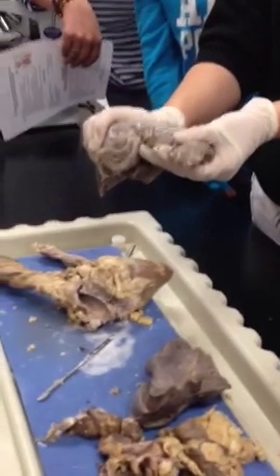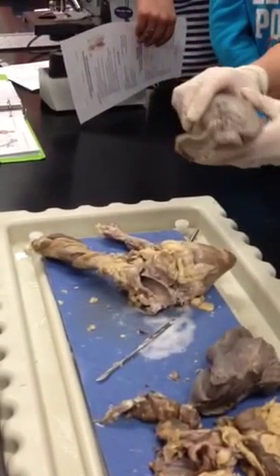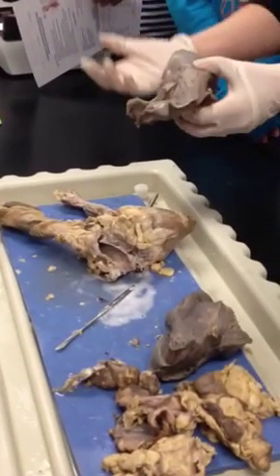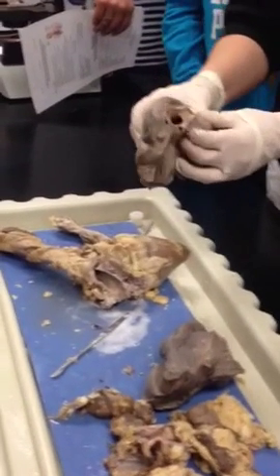Sheep are on all fours, so it's kind of confusing when you're trying to compare to a human. Put the human on all fours, I guess. But as far as the lobes go, I'm sorry, that's just how it is.